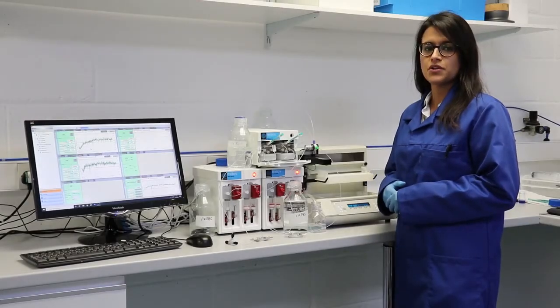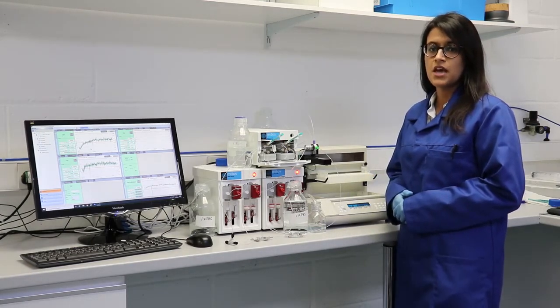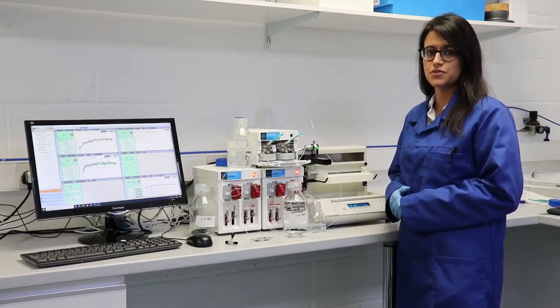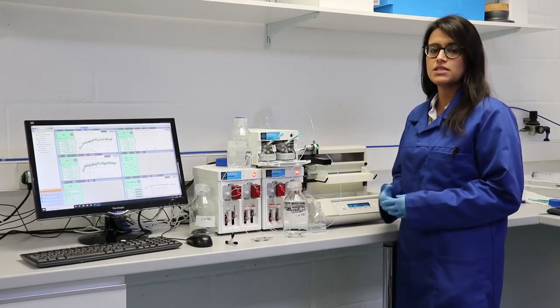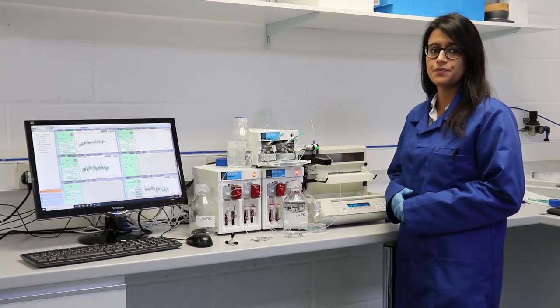Formulation of your lipid nanoparticles is an essential step in the development of your therapeutic. There are no off-the-shelf solutions to formulate your bioactive into these lipid nanoparticles. Significant development and optimization is required to formulate a delivery vehicle.